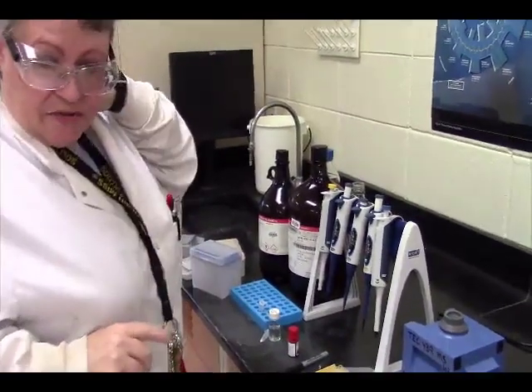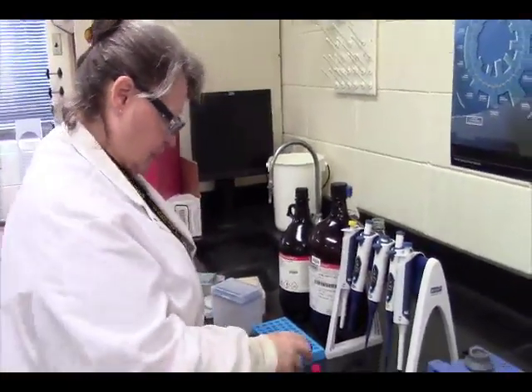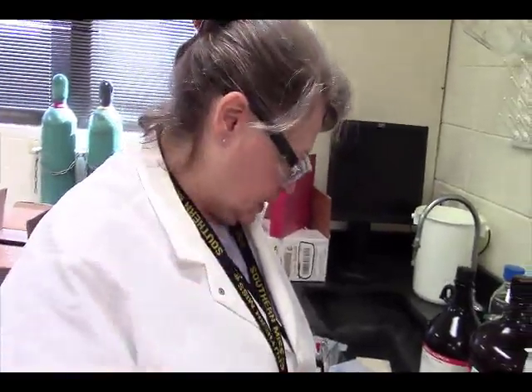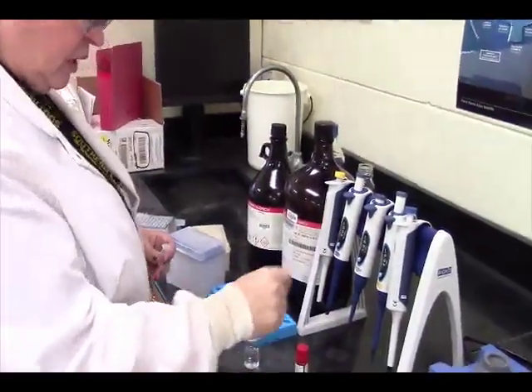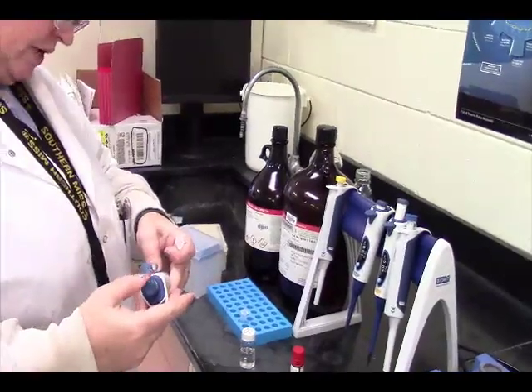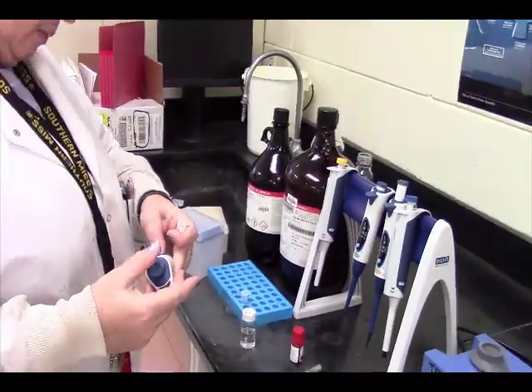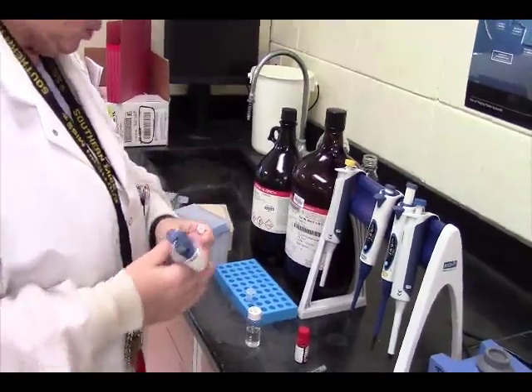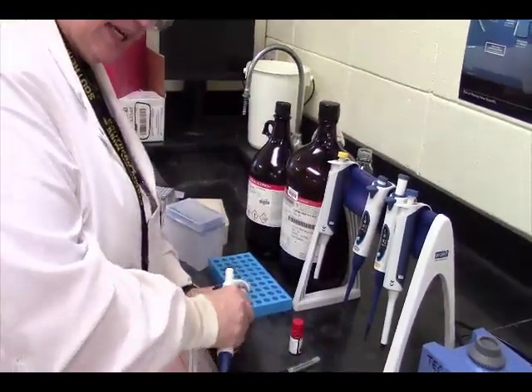Now this is going to have to be LDI because our mass is too low to have a matrix in there, but that's okay. It'll fly with laser desorption ionization. All right, but what we have here is universal. Probably too much, but that's okay. We have universal indicator, and what I'm going to do is add a milliliter of solvent. The solvent here is going to be a 1-to-1 methanol water with a 0.1% acetic acid.